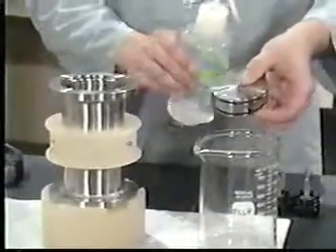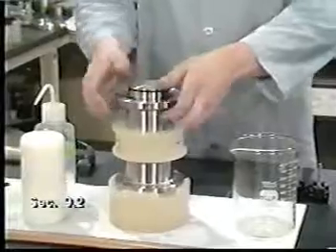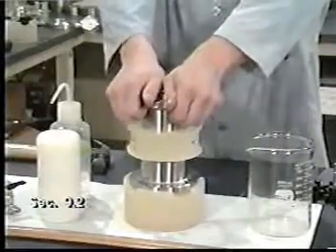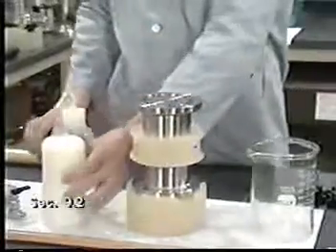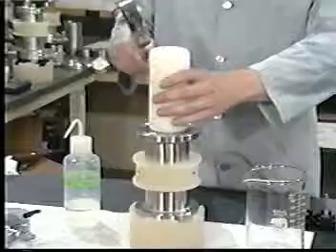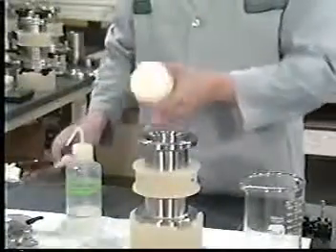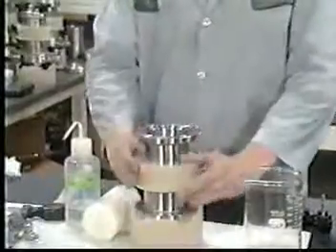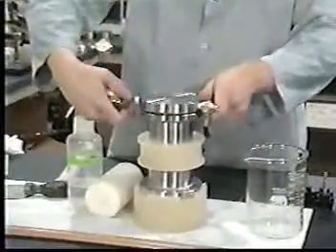Partially assemble the ZHE by placing the piston inside the body. It will be useful to first moisten the O-rings with extraction fluid. Adjust the piston so that the volume inside the extractor is just sufficient to hold the amount of sample being used. Secure the bottom flange containing the gas inlet-outlet valve to the device.